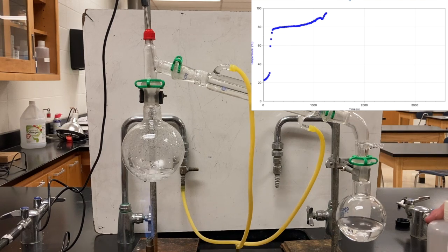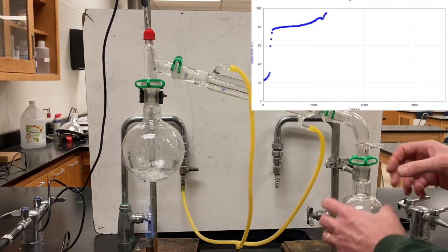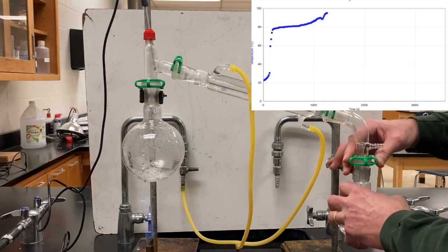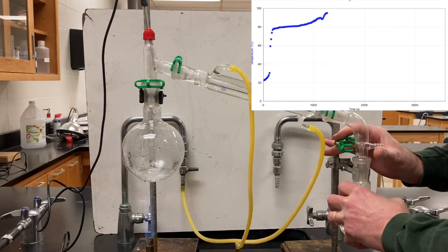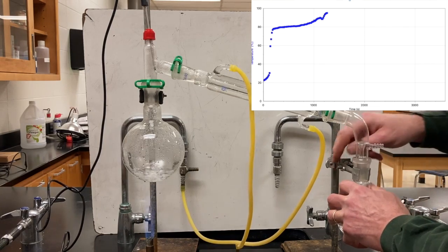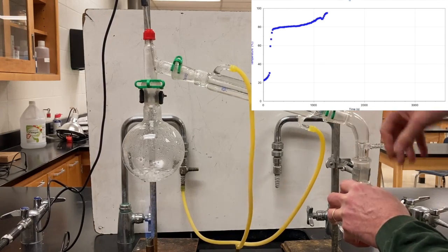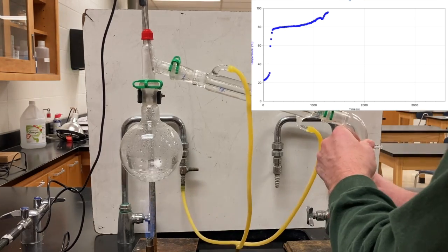Now the alcohol appears to have completely stopped boiling because the temperature is beginning to shoot up kind of rapidly at this point. And you can see that the dripping has decreased a lot in the cold end. So I'm going to take this opportunity to disconnect the cold end flask because I think the next thing that will happen is I'll begin to start having water condense in my condenser tube and I'm trying to accomplish a separation of this mixture and that would sort of defeat the purpose.